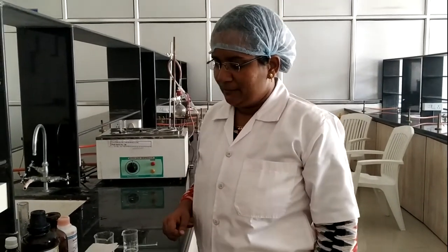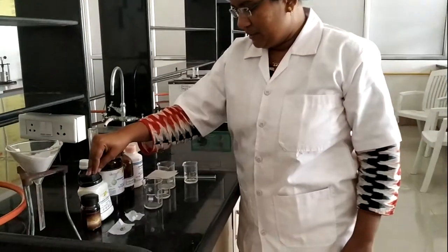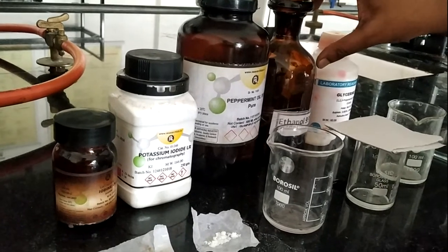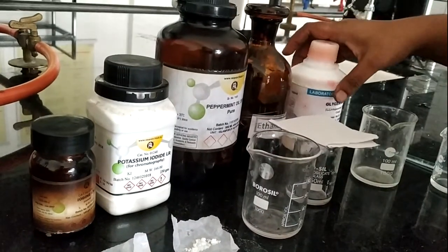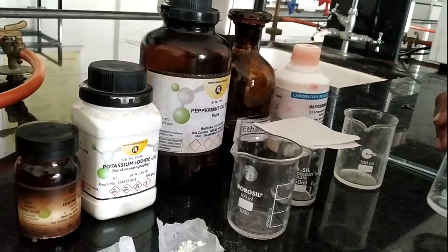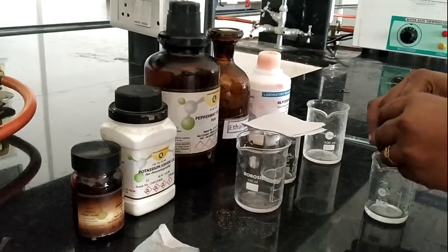In our laboratory, we have iodine which is previously weighed, and potassium iodide which is also weighed. We have peppermint oil taken into a beaker, alcohol 90% taken into a beaker, and glycerin also being taken into a beaker. This is purified water. First, we are going to add potassium iodide into the beaker.